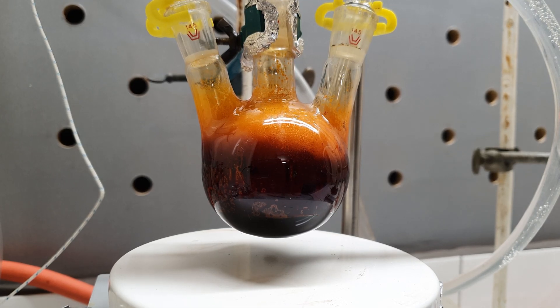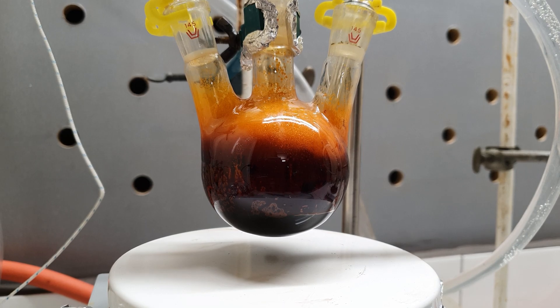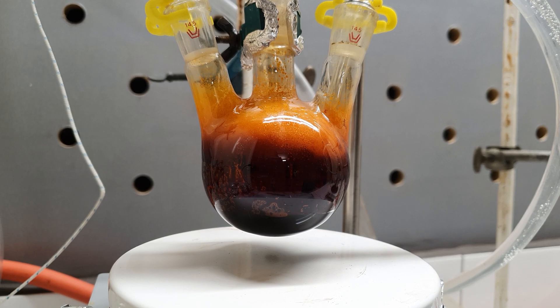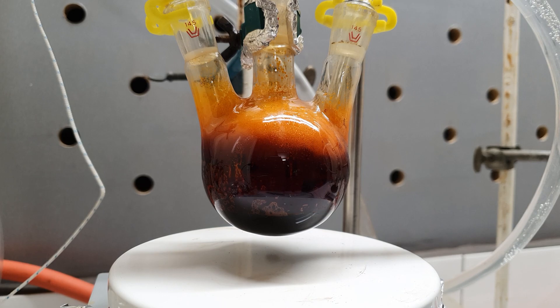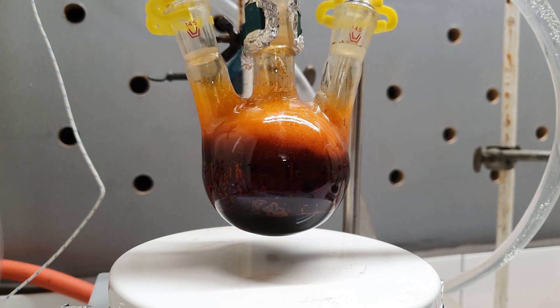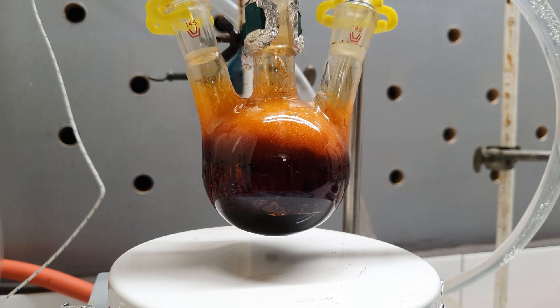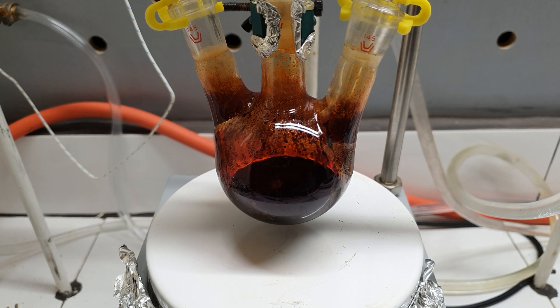Everyone knows that in order to have fire, you need oxygen in the atmosphere. However, if you know chemistry on a decent level, you probably know that oxygen is not the only element that can set things on fire. Fluorine, chlorine and even bromine can do this trick too. In this case, we are burning the iodine in the chlorine atmosphere. The interesting thing was that the flame wasn't nearly as hot as you might expect.